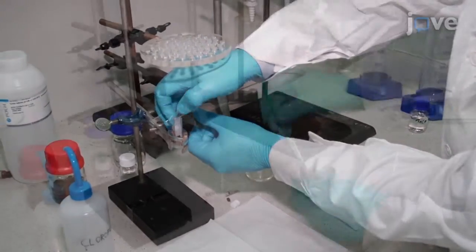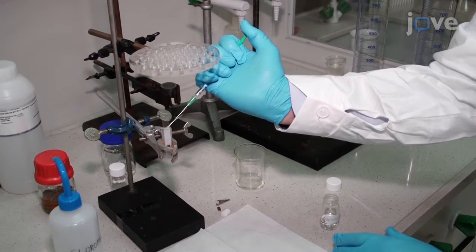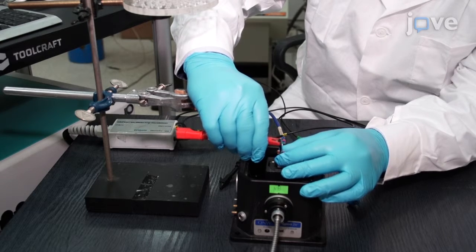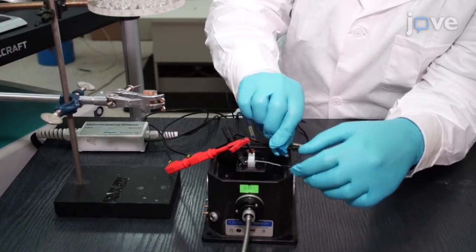It is very important to set up the spectroelectrochemical cell properly and in a way as similar as possible to the spectroelectrochemical cell used to record the blank spectrum. Only this will ensure the registration of good results. Place the cell in the spectrometer and reconnect the electrodes to the potentiostat. Apply a neutral potential to the cell and acquire a starting spectrum.